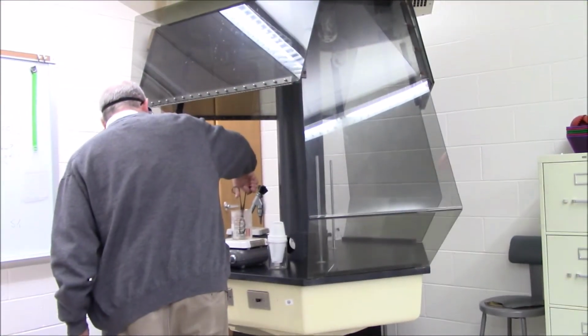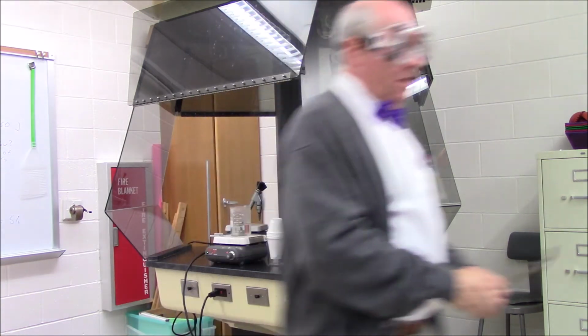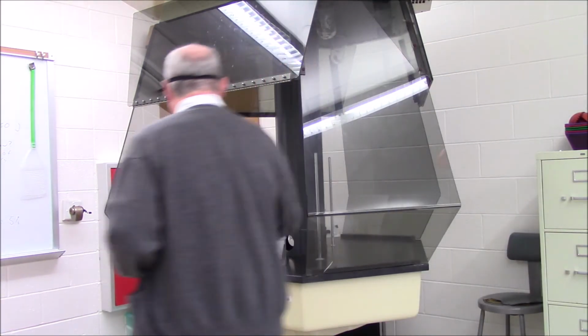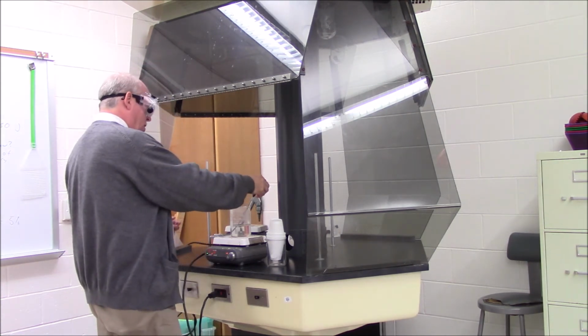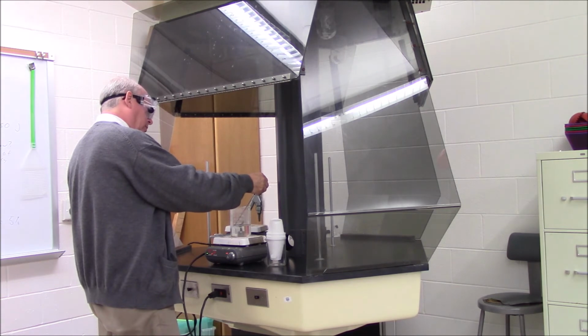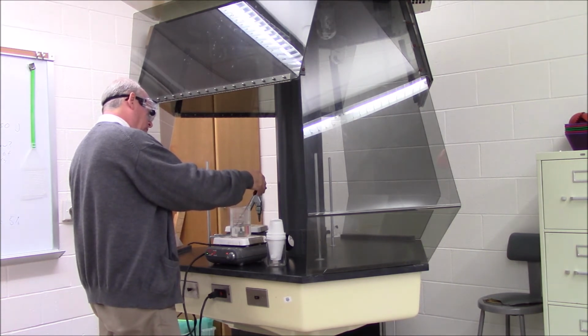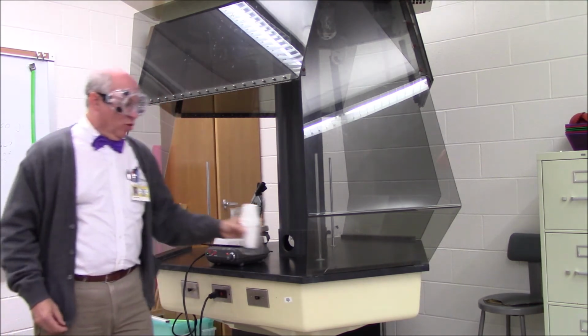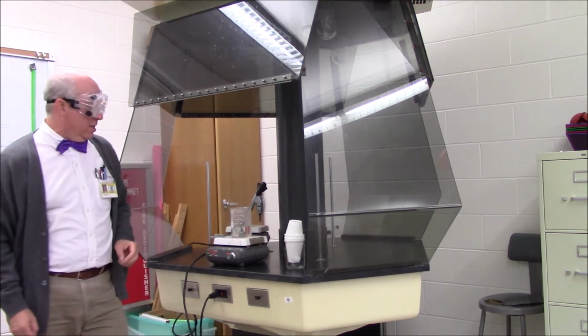I'm going to put the lead in the water and get the temperature of the hot water. It'll be boiling soon. And the temperature of my calorimeter water is 22.0 degrees again.